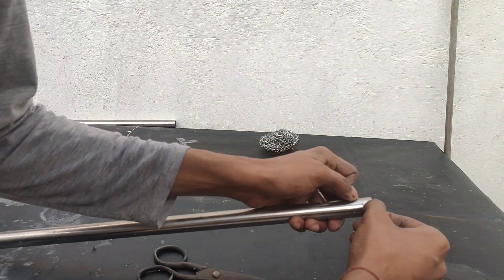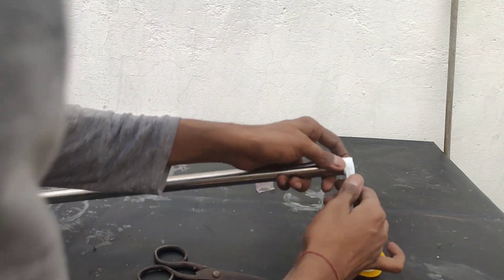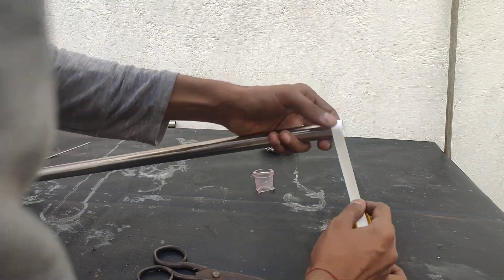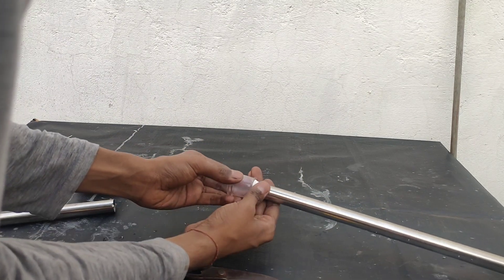Having done that, I wrapped some teflon tape at the top of the column so that I can fix my B24 socket for placing my still head in it. As you can see here how I have fixed it.